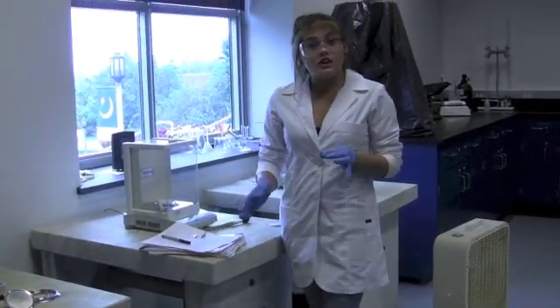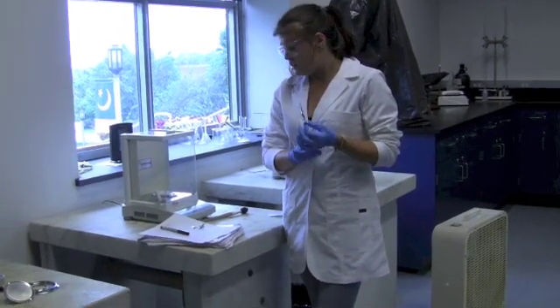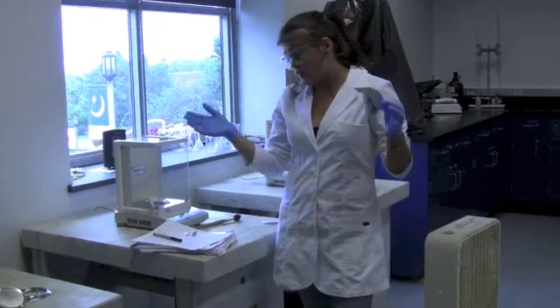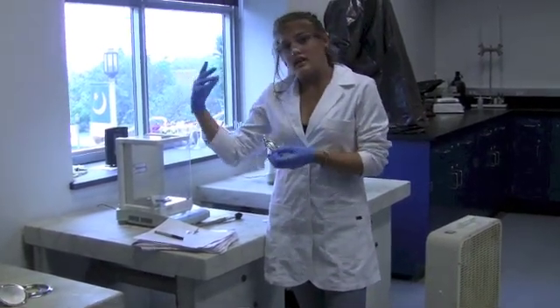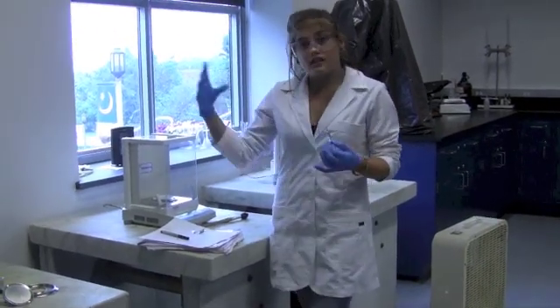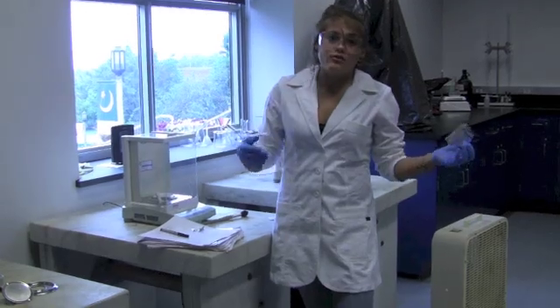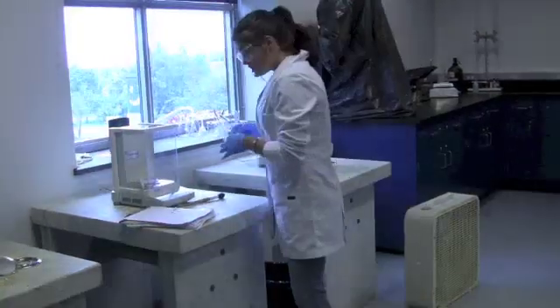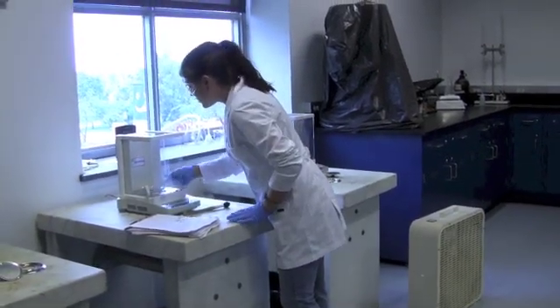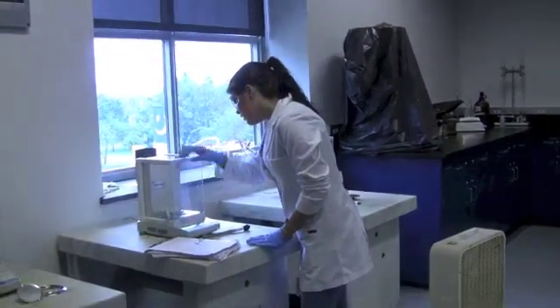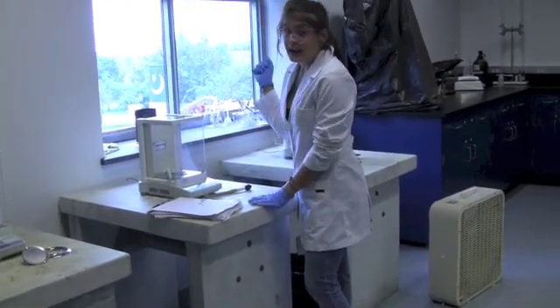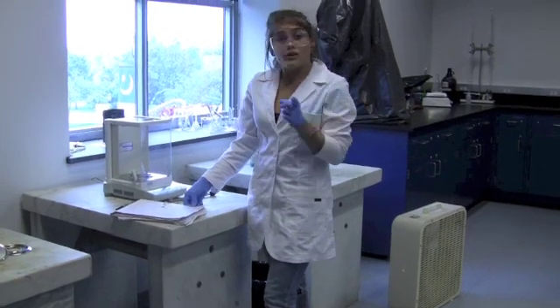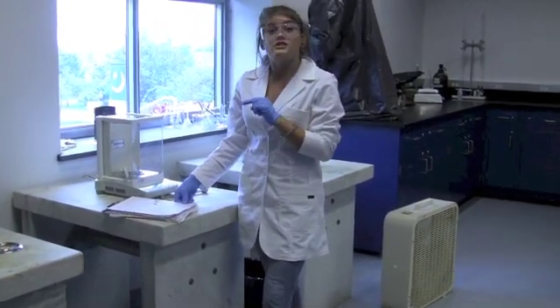Now, always make sure to record your numbers to four decimal places, and you need to make sure to not waste too much time trying to get exactly 0.500 grams. It could be anywhere from 0.49 and numbers after that to 0.51 something something. So say you have 0.4932, that's acceptable, or 0.5127, they're all within an acceptable range. Just make sure not to be too far off. My reading is 0.5186. So I brought my lab book back with me so that I didn't have to try and remember the number on my way back to my station. Always remember to bring your lab notebook back, and always remember to record to four decimal places.